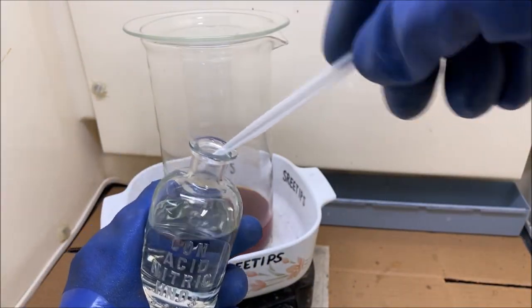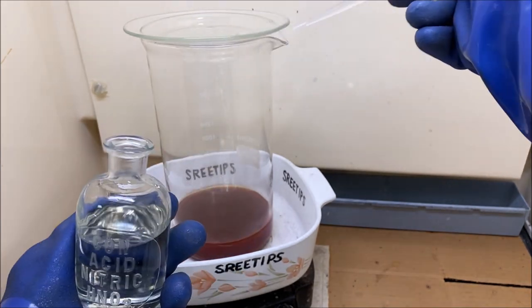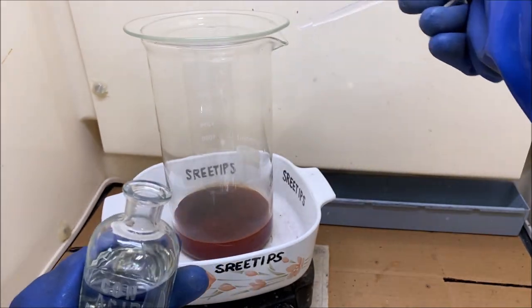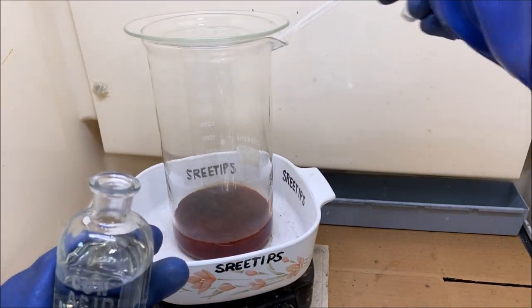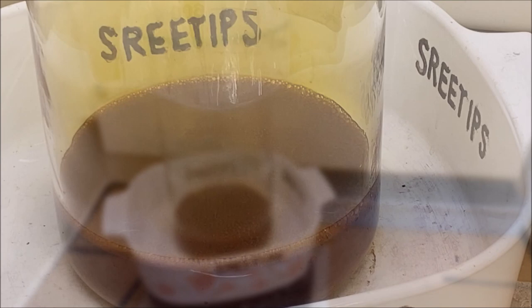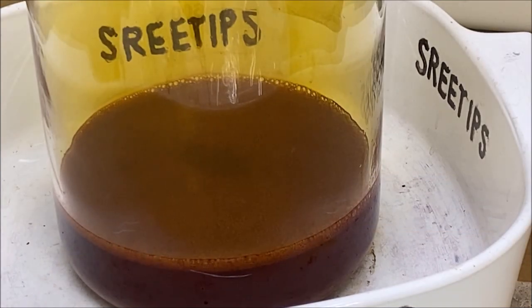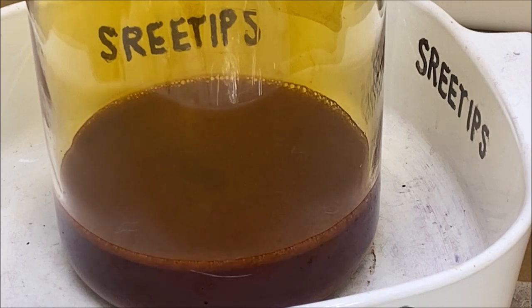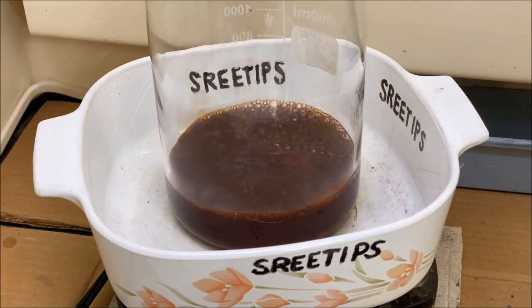Like I said, I have very little experience with platinum and that's why it's hard to judge whether or not I've got everything back in solution. The reason I'm doing this is to do another precipitation to see if we can get the platinum salt cleaned up. Now that I've got that extra hydrochloric acid and extra nitric acid in there, I'm going to go ahead and crank the heat up and let the solution evaporate down to a syrup.